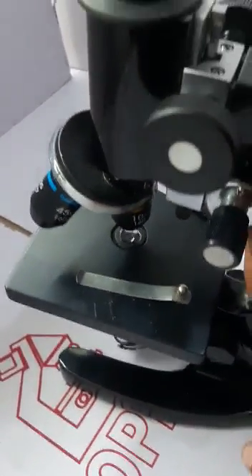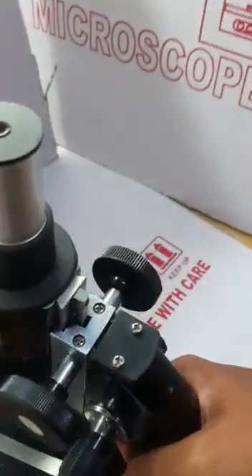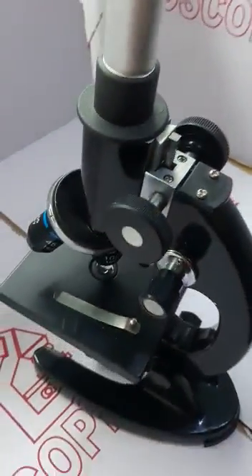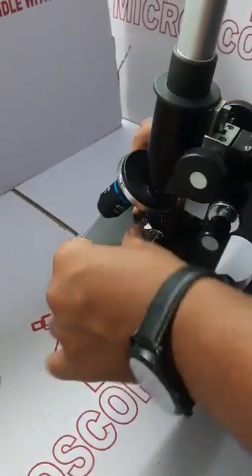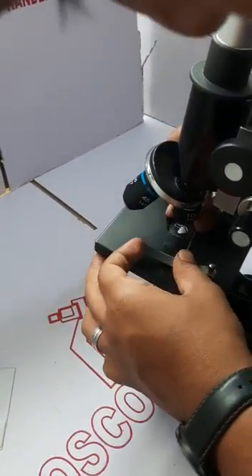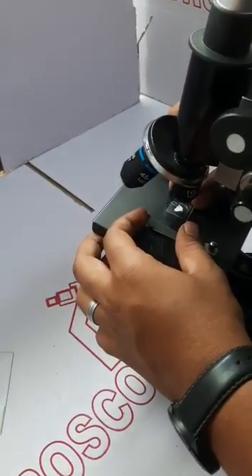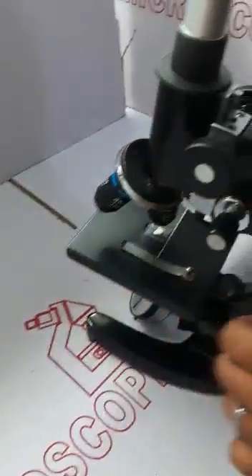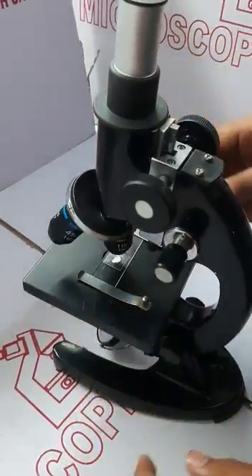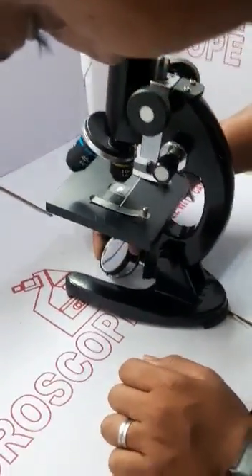For creating a sample, just keep in mind that you keep the microscope at a 90-degree angle, place the slide properly, and set up the light first.